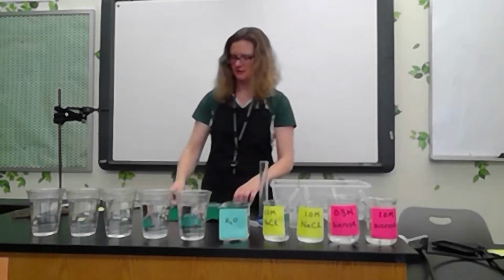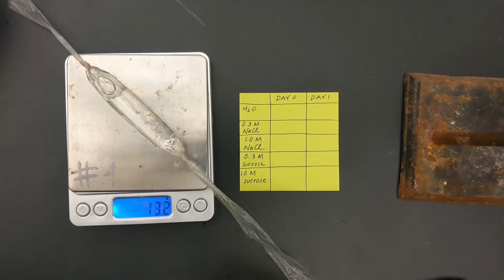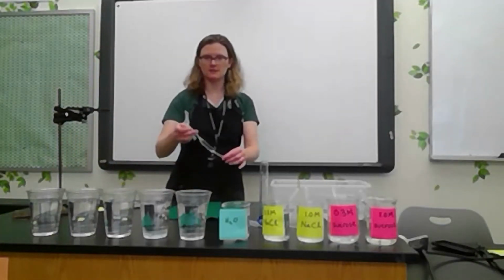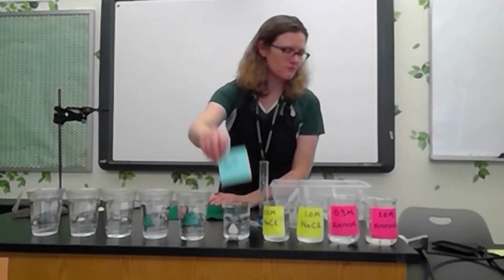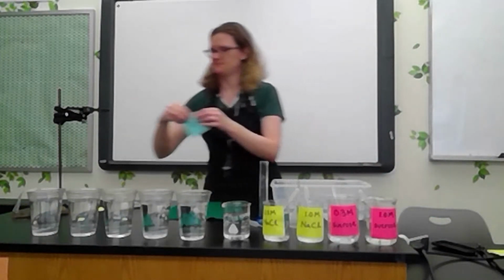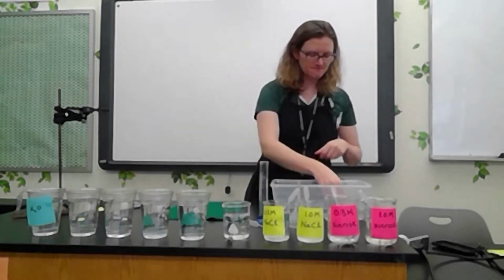And then I'm going to blot this cell dry on some felt, and I'm going to take its mass. And then I'm going to put this cell in an environment full of water and use my Post-it note from before to create a label. All right, and then I'm going to do the same thing to create my 4 other cells.